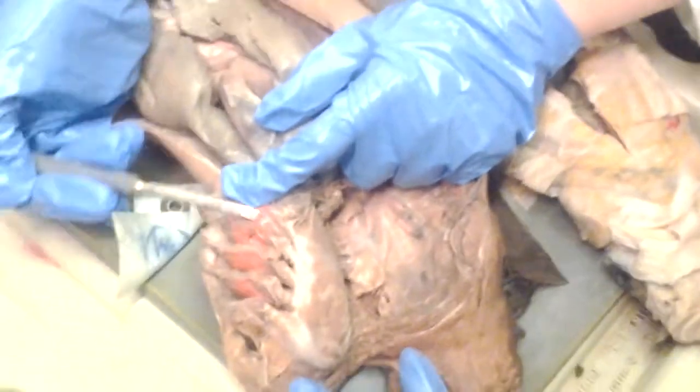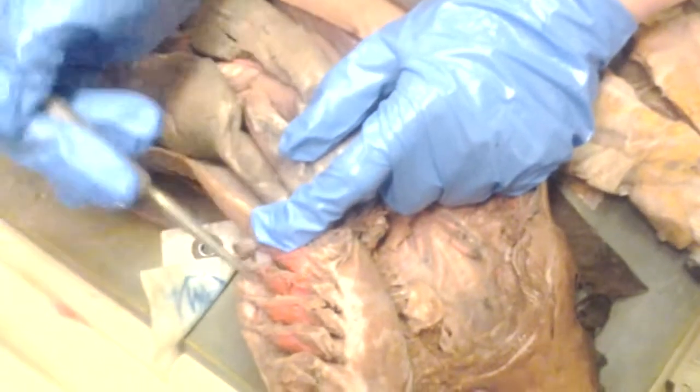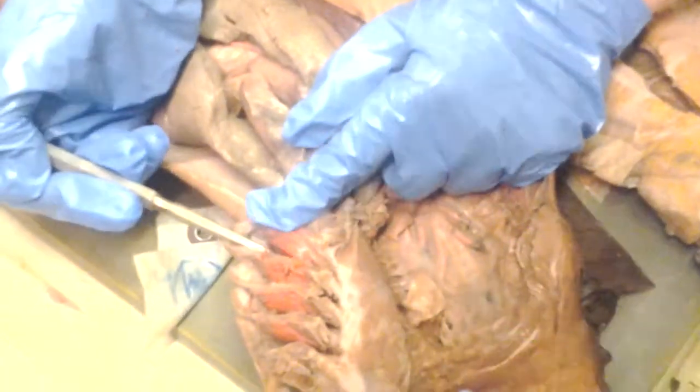Now, a demibranch is half of a gill. So this would be one demibranch. Two together would be a holobranch. So this and this together is a holobranch. But one of them is not a complete one, right? The fifth one, the last one? Yeah, the last one is not. What's the reason for that? Read about it. It's just evolution. Okay. What's not complete?